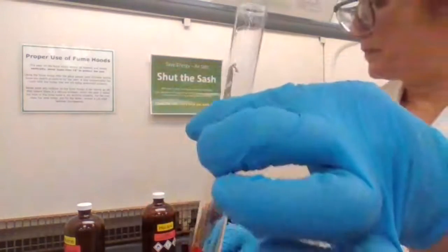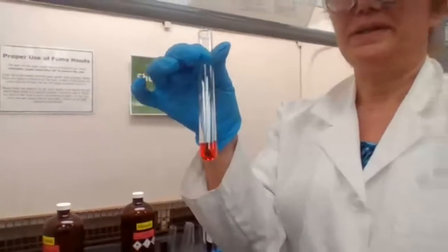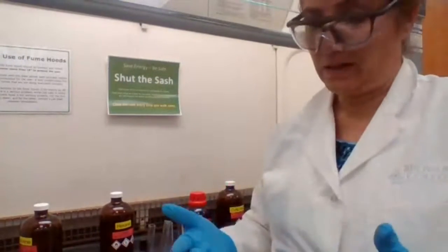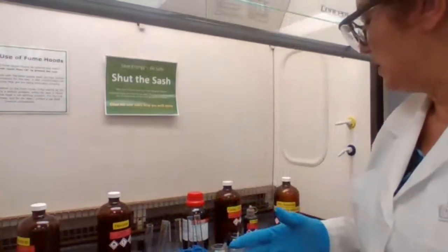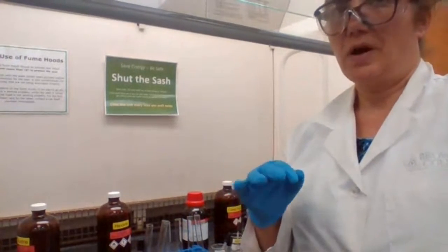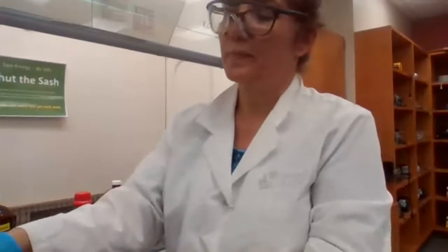That's toluene plus bromine. Aromatic compounds, even though they have pi bonds, their pi system is the identity for aromatic compound. Aromatic compounds do not want to lose stability, and they don't want to lose that pi bond. So there is no addition reaction between aromatic ring and bromine reagent or bromine solution.